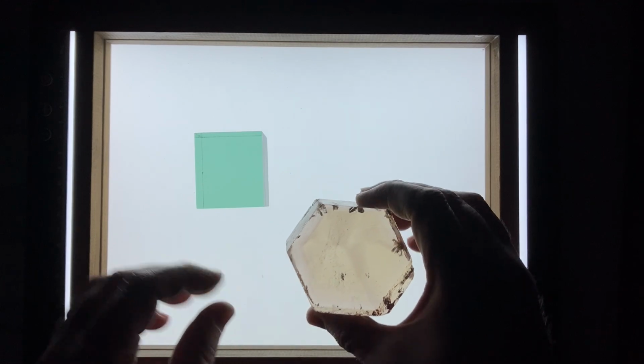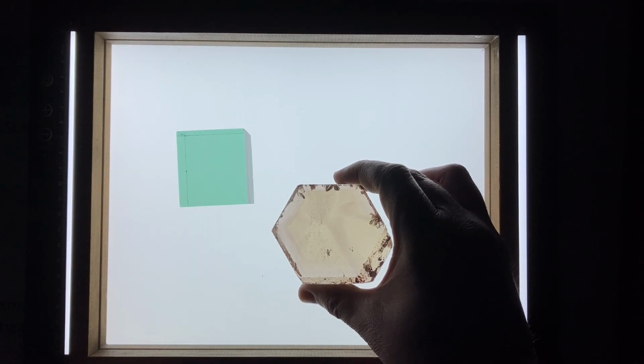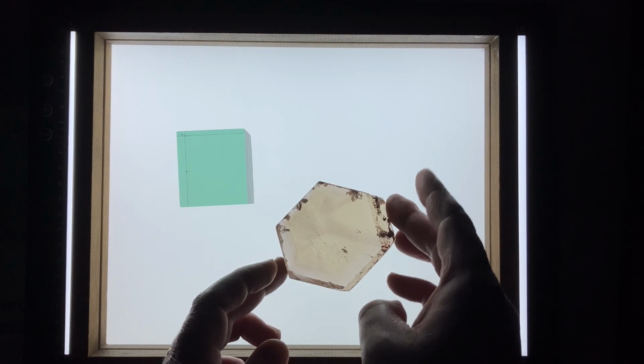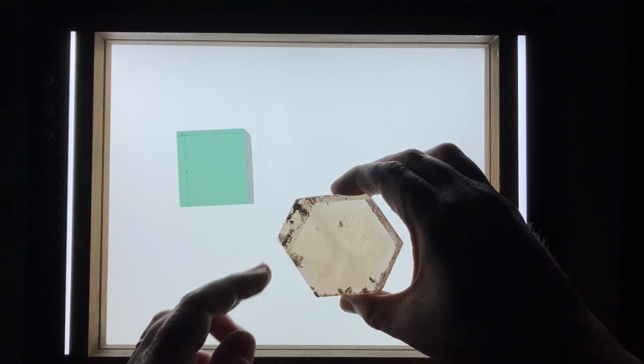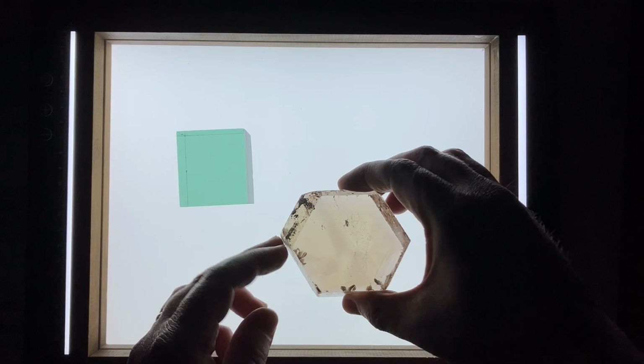Let's take a look at our quartz crystal now and see if it does anything interesting in plane polarized light. Right now we're looking down the C crystallographic axis of our quartz, and as we rotate the quartz you'll notice that nothing really is happening. Well, that's boring. But that's just because the C crystallographic axis isn't the right direction through our quartz crystal in order to view pleochroism. We need to be looking along the plane of the A-axis in order to view the maximum pleochroism for our quartz.